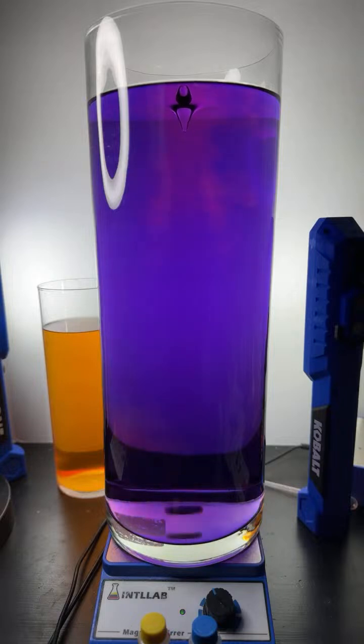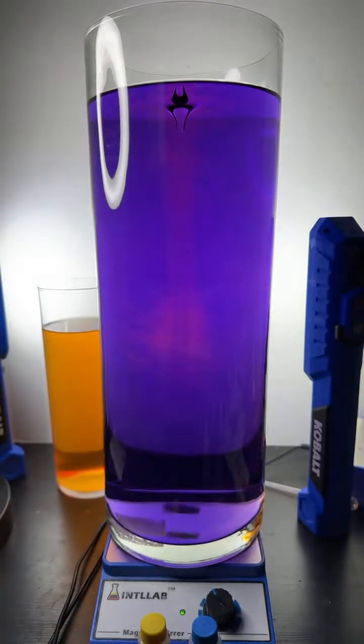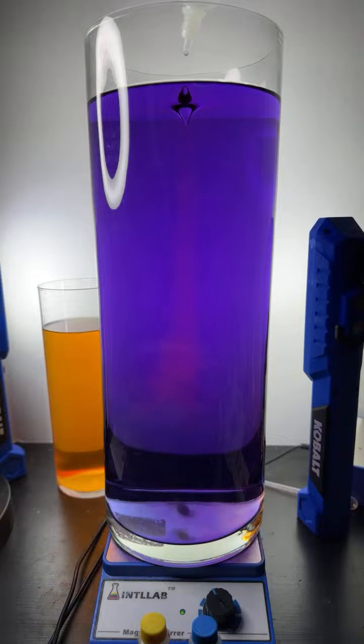It's pretty interesting. Malik, this is not dilute acid. It is 20% by weight hydrochloric acid, which is fairly concentrated. That's why I'm wearing gloves. But as soon as I stick it in, it's like 1.5 gallons of water. It's diluted tremendously.